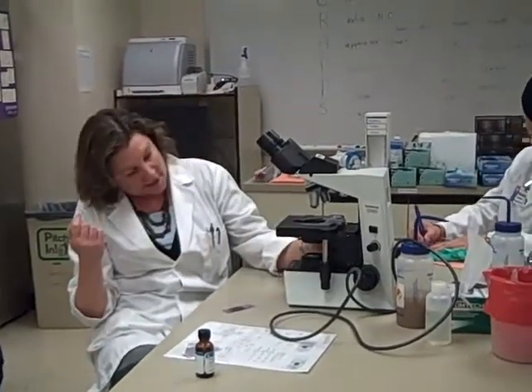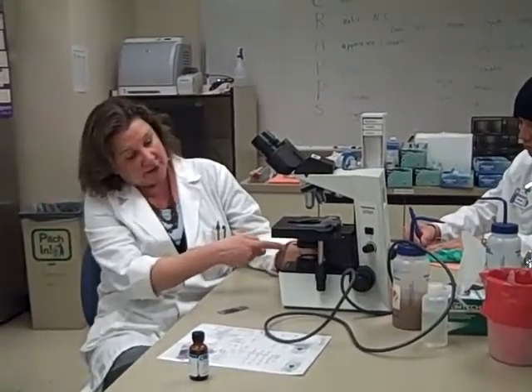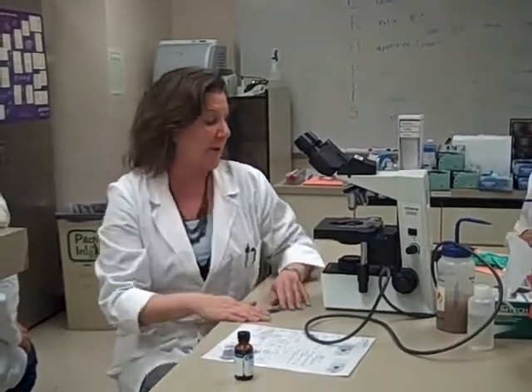So when we look at wet and unstained, we like to bring our condenser down because that increases the refractive index. But in hematology, when we're looking at stained blood, it's dry, we want to bring that condenser up because we like light. So bring your condenser all the way up when you get your microscope out.